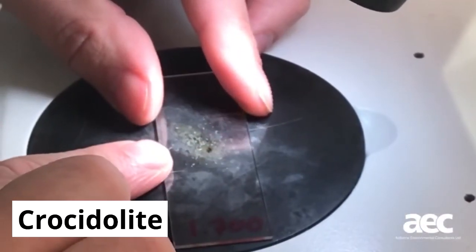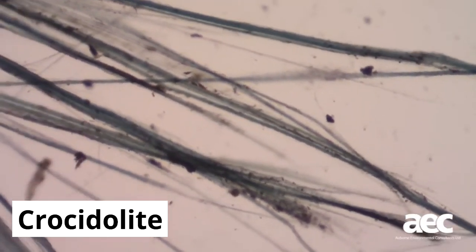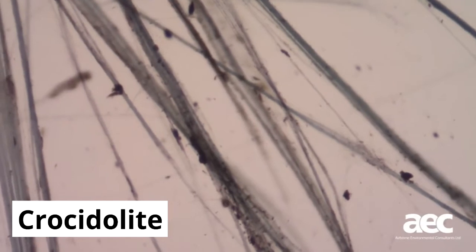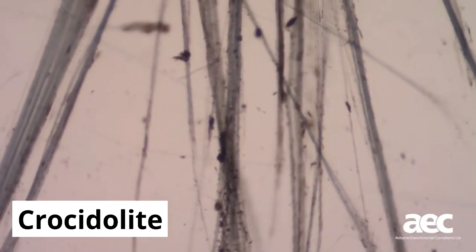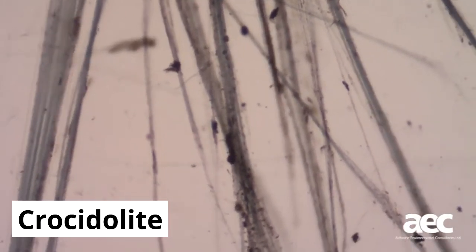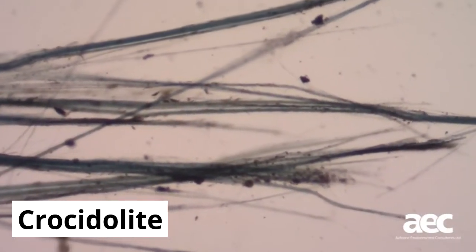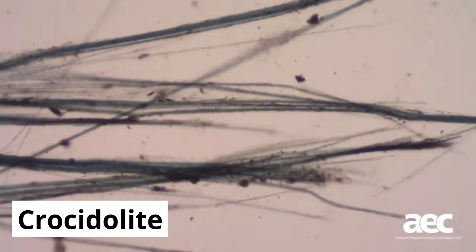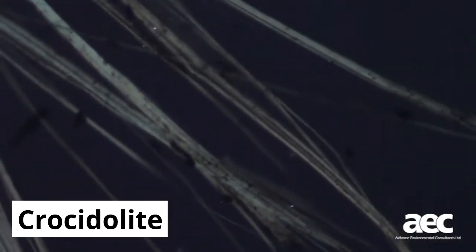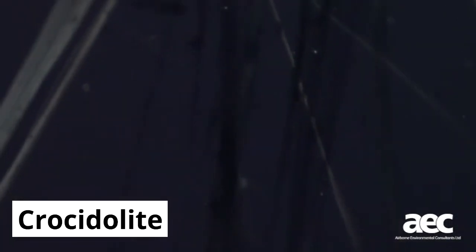Crocidolite shows some pleochroism, which is a colour change, shown here as it is changing from grey to blue under plain polarised light. This hints at the fibre being crocidolite. Next, you have the birefringence and extinction testing. This must show the fibre appear and disappear as we rotate it under a setting referred to as crossed polars. This confirms we have a mineral under the microscope.